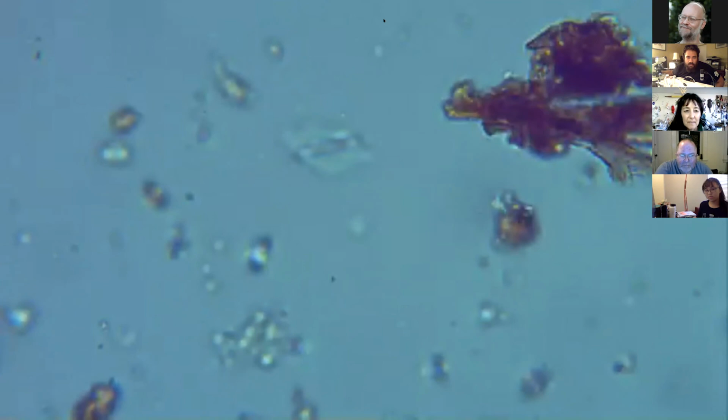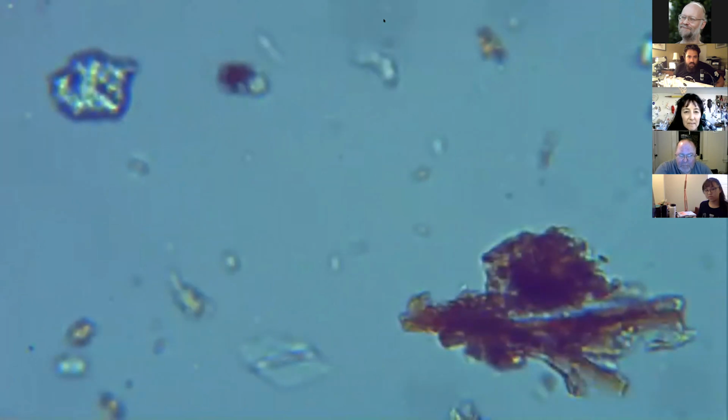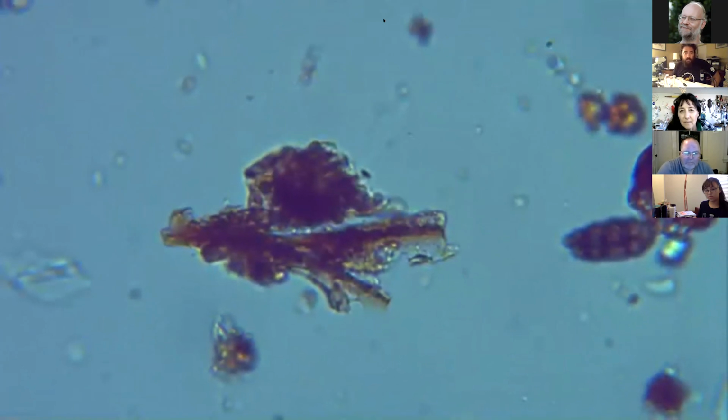It also probably would have helped to actually mix the background, but you can see some cocci in there. Got some grains of sand. And what we're looking at right now is a microaggregate. So it's a little clod of sand, silt, clay, and humic substance or organic matter, which they're basically making these bacterial glues. But we do have generally good structure at a 1 to 5.